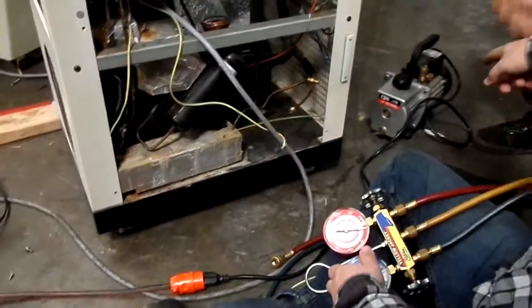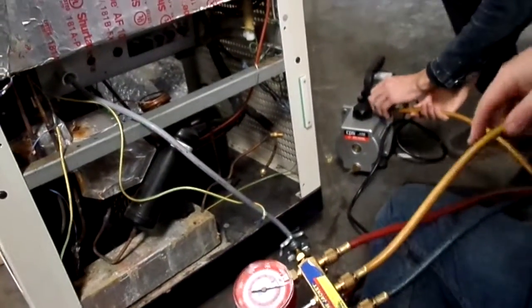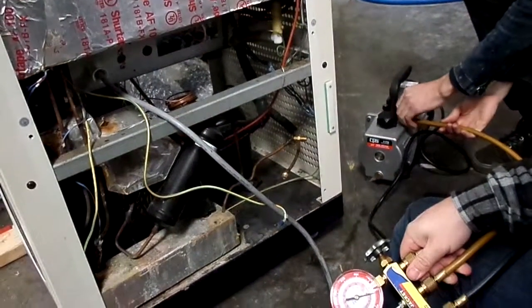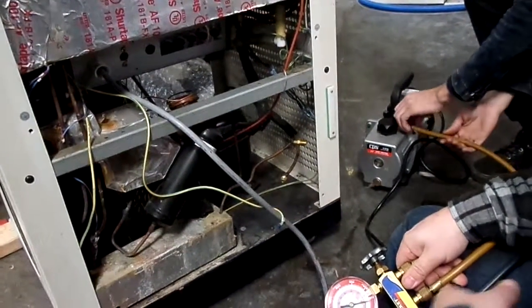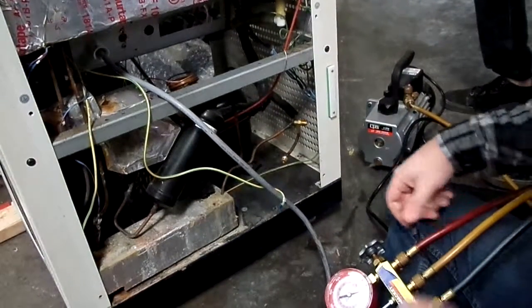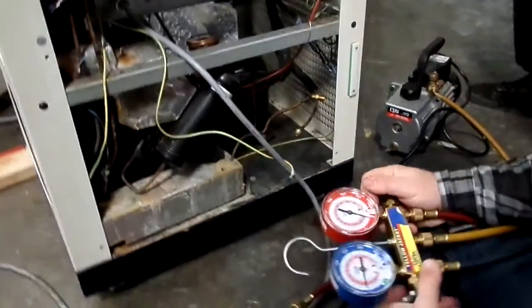So you put your yellow into your vacuum hose. The yellow goes to either your vacuum pump, your recovery pump, or freon tank. It's what's going into the manifold of the gauges, and then the red and the blue go to the machine. Go ahead and turn that on, just to be sure.